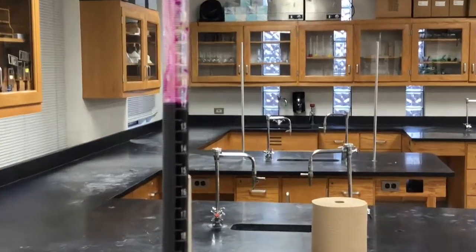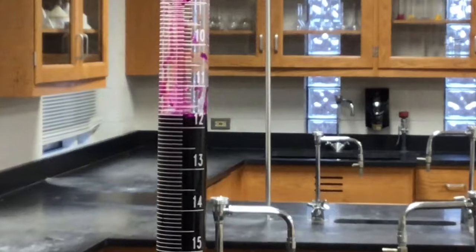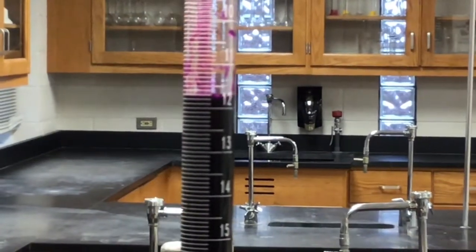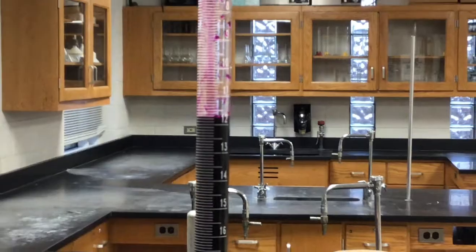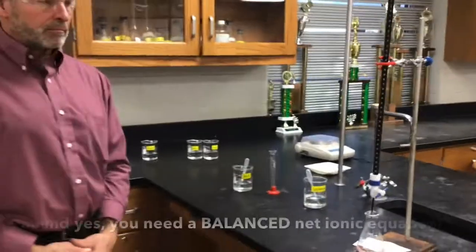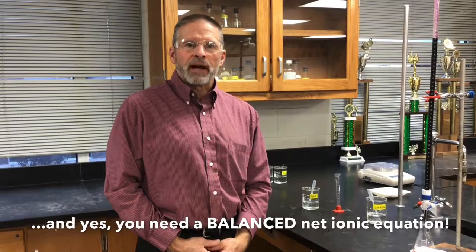Sometimes the iPad camera chooses something else to make as its focal point. Oh, okay, there we go. Yep, do the best you can with that volume. Okay, so 2 good trials. Sample B. And you will hear later what you're actually going to try to calculate about the peroxide solution.